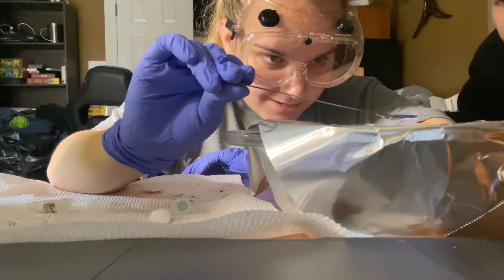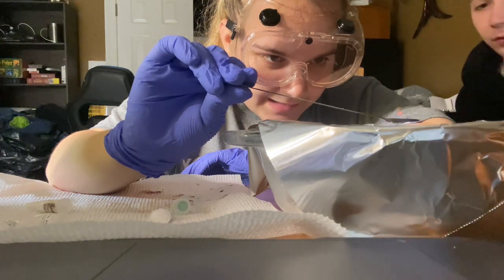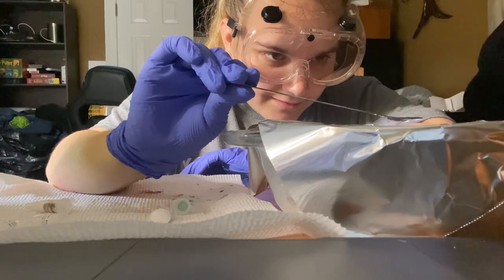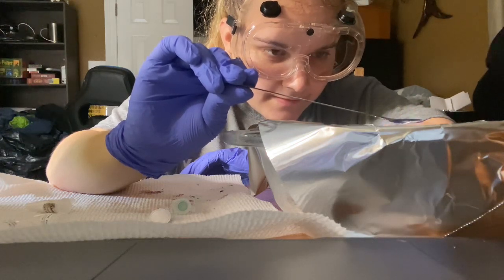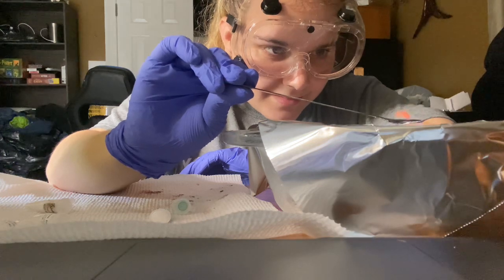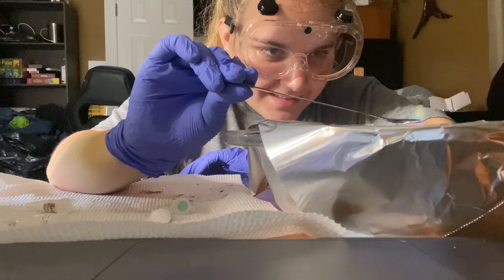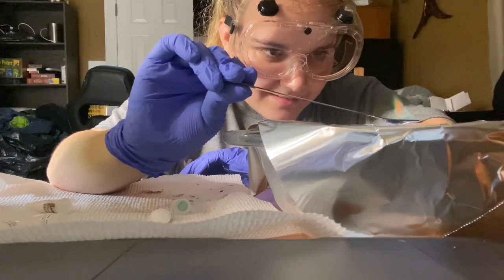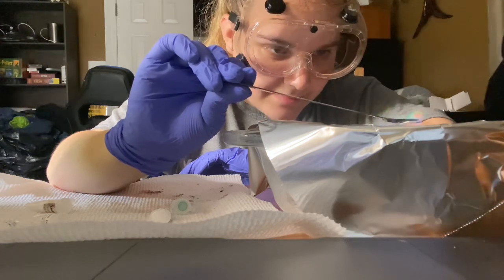It's melting. So it's not a salt. If it's melting, it's more than likely not salt. Okay, it's turning green. I can see some green. So what does that indicate? So it has copper in it. Copper nitrate, or it has copper in it.